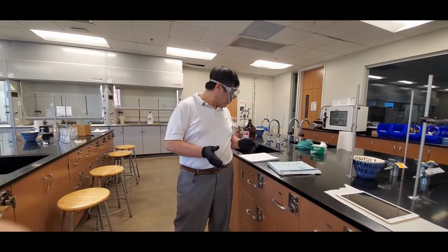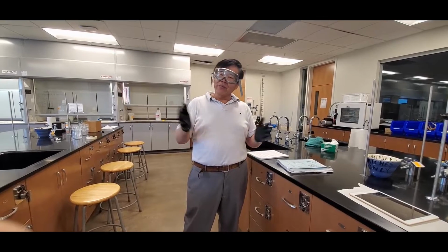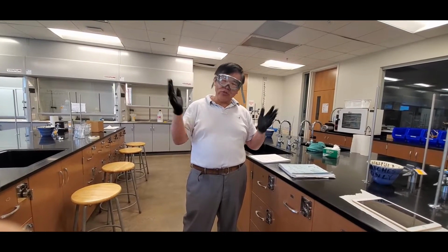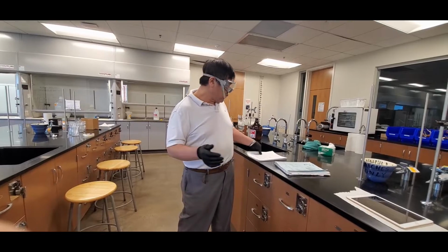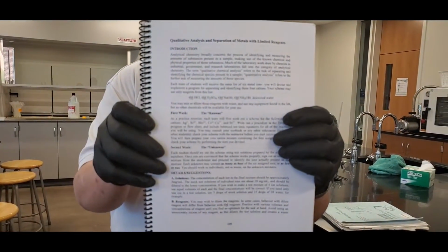Today what we're going to do is the qualitative analysis lab. It's a fun one. I wish you were here. But anyway, since you can't do it, I'm just going to show you guys how it's done, okay? So the lab that we are doing is this guy right here, the qualitative analysis lab, okay?